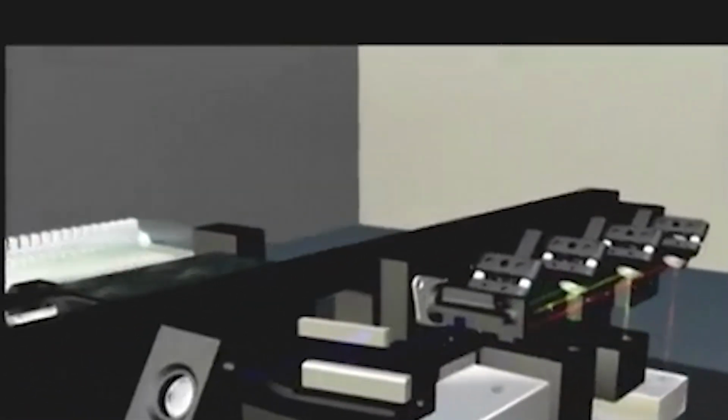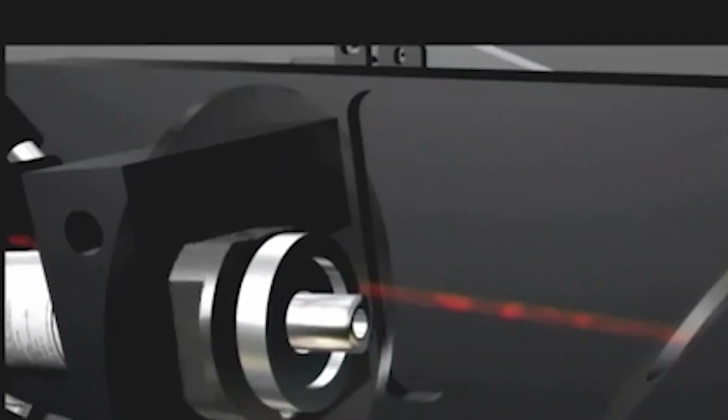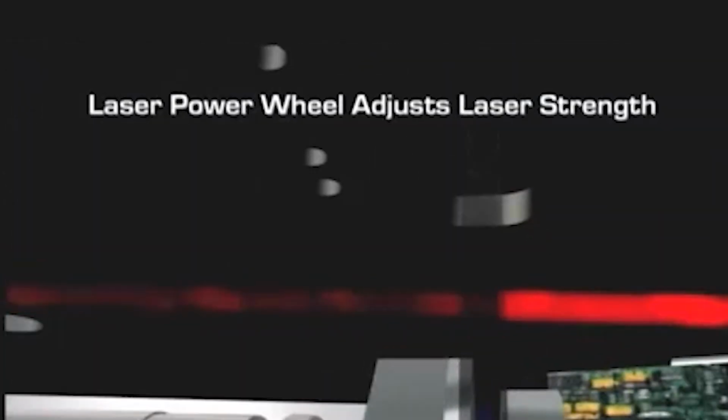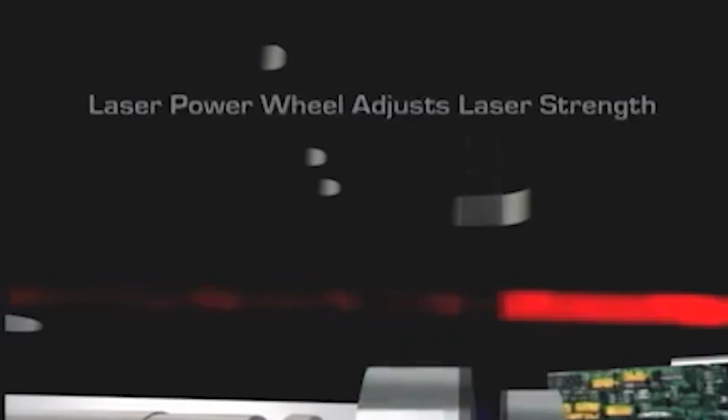The GenePix Autoloader 4200AL can be configured with up to 4 lasers. A neutral density filter wheel can be used to attenuate the laser power if necessary for especially bright samples. The laser excitation beam is delivered to the surface of the microarray slide.